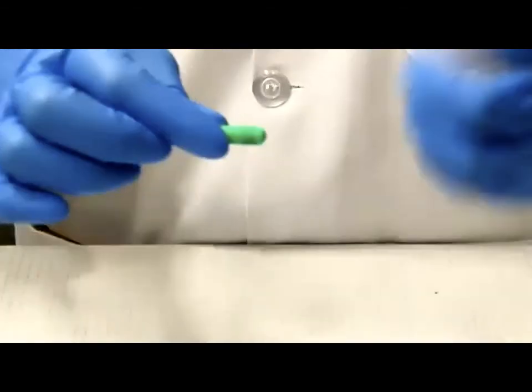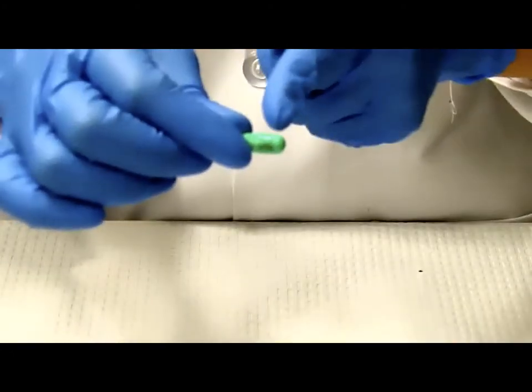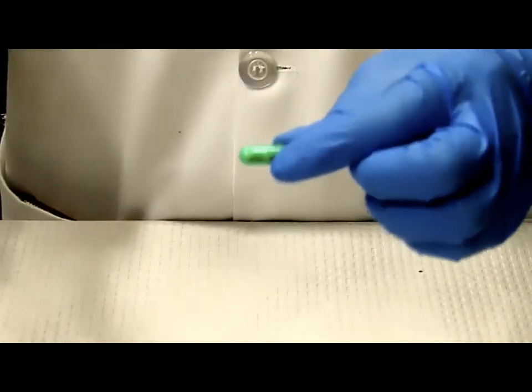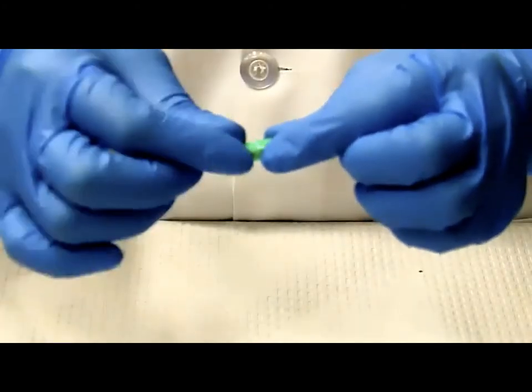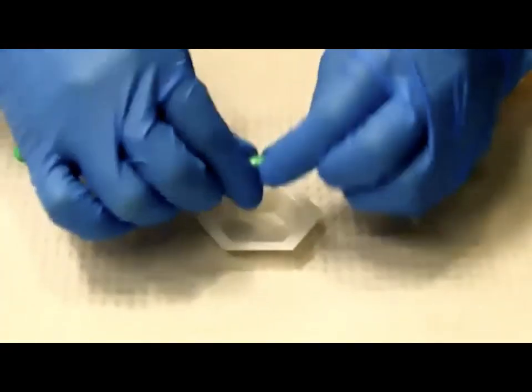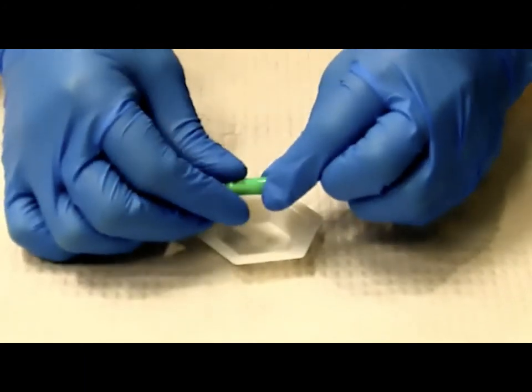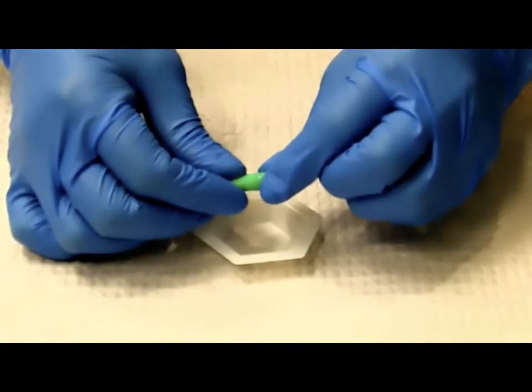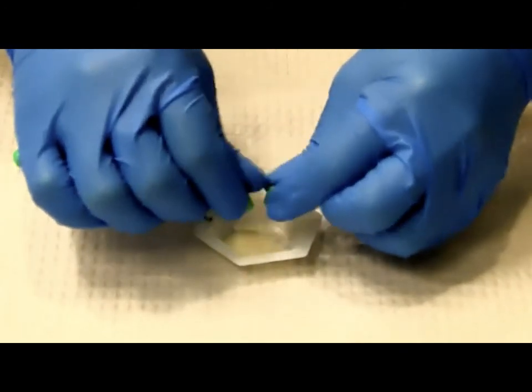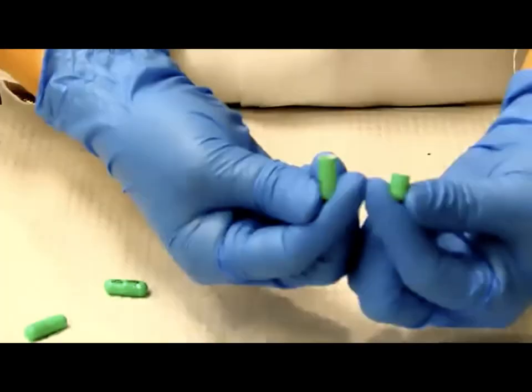With one of your hands, hold on to the head. This is where the lock is. There's a little lock here, so you want to gently squeeze the lock. At the same time, the other hand will twist and pull the body, trying to pull them apart. One hand squeezes and the other hand tries to twist and pull. At some point you will feel the lock being unlocked so that you can pull apart and squeeze all the powders out gently. And you can tap as well and double check before you say that's the end of the process.